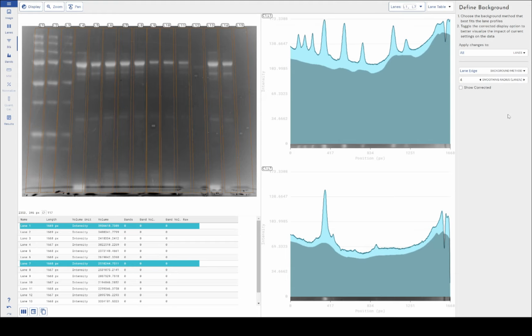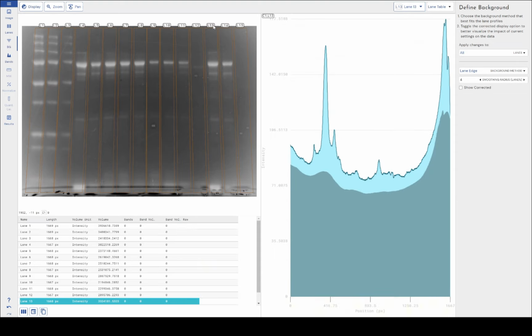We've got lane edge background subtraction, which is mainly designed for very busy lanes, somewhat like this, whereby you've got lots of bands that spread into each other with high signal, and there's no real definition of where you would say there is background. There's no real gap in DNA, RNA, protein. You might have lots of proteins that are all very similar size, so they all bleed into each other. In situations such as this, it's very hard to get a background from within the lane profile.